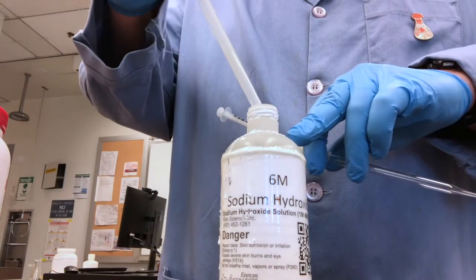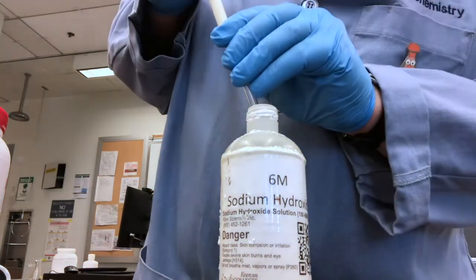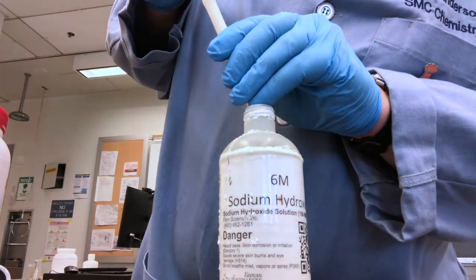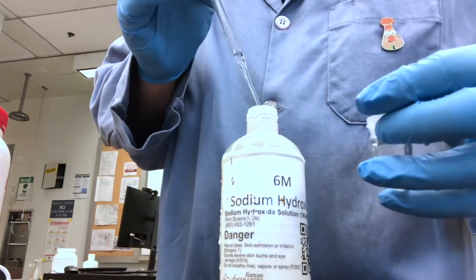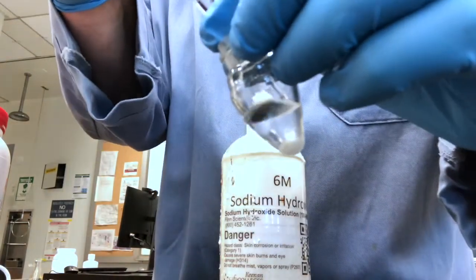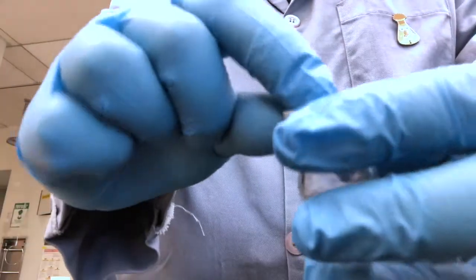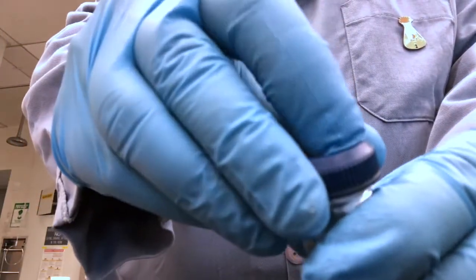Normally it's not the correct practice to pipette directly from the bottle. It does look better on camera, so you know I'm adding the sodium hydroxide. In this case, we're adding 0.4 milliliters of the 6 molar sodium hydroxide. You'll notice when the hydroxide goes in, you see the mixing lines showing that the rest of the alanine mostly begins to dissolve. Then we place the cap with the Teflon side down and then screw it into place with the plastic cap, and then check to make sure that it's holding. And we can agitate it and shake up and dissolve the rest of our solid.